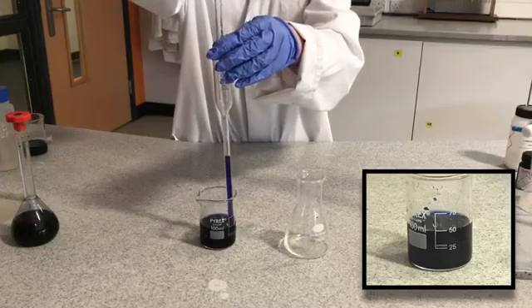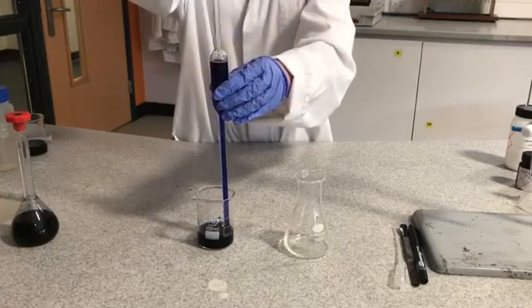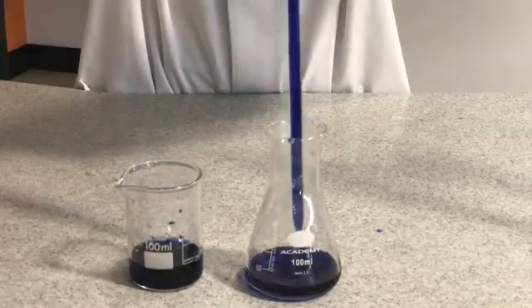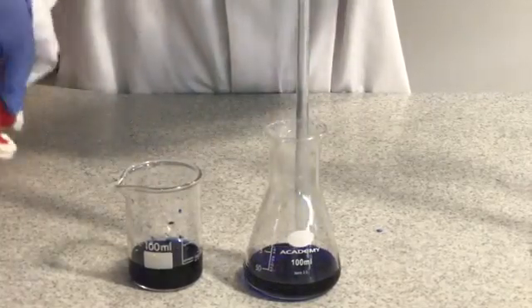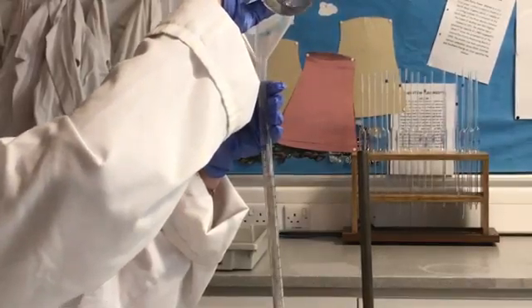Add 25ml of DC-PIP into a 100ml conical flask. Fill the burette with the vitamin C solution to above the zero mark.